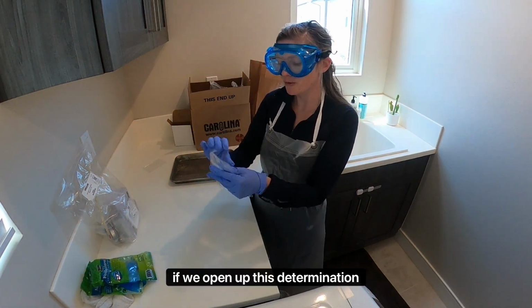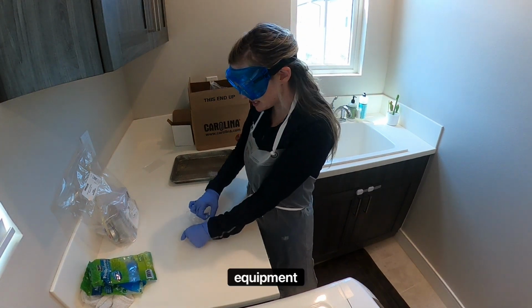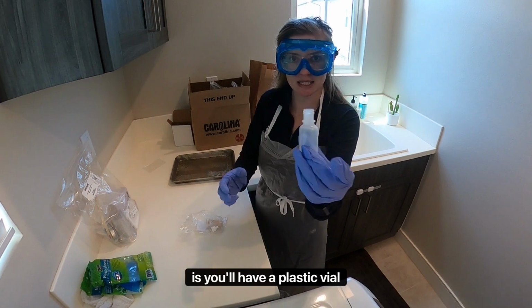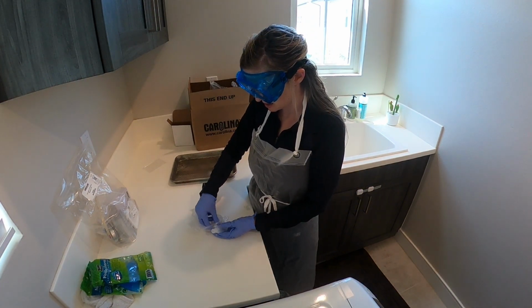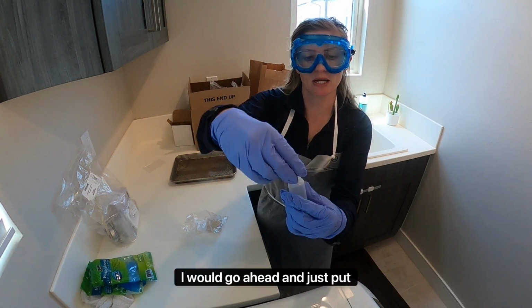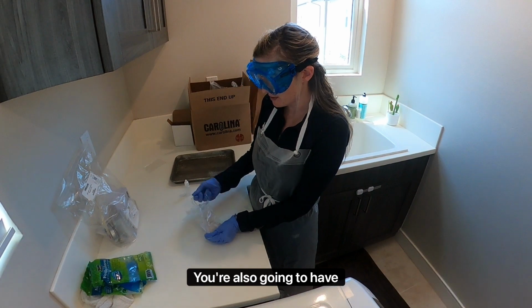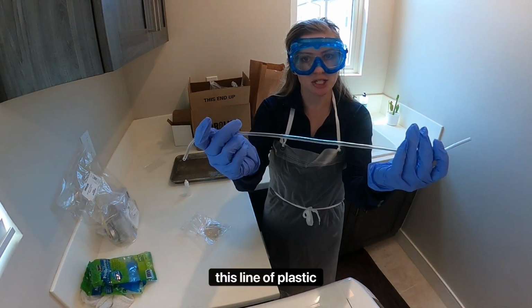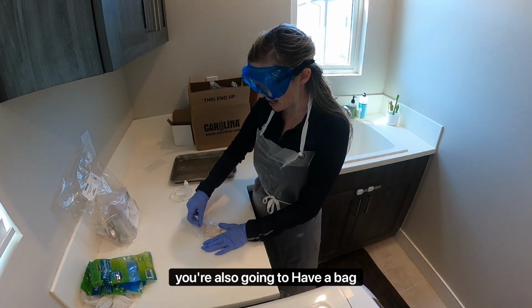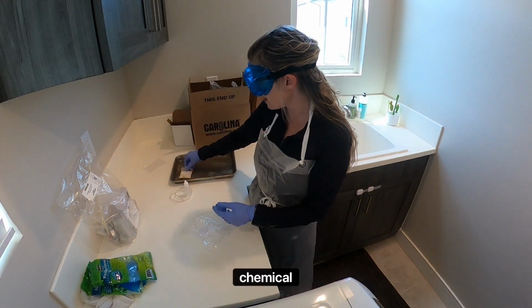If we open up this Determination of the Ideal Gas Law equipment set, you'll have a plastic vial that looks like this, and a dropper top that looks like a little white cap. I would go ahead and just put that on top. You're also going to have this line of plastic tubing. We want to set that aside. And you're also going to have a bag of yeast, and we're going to go ahead and put that onto our chemical tray.